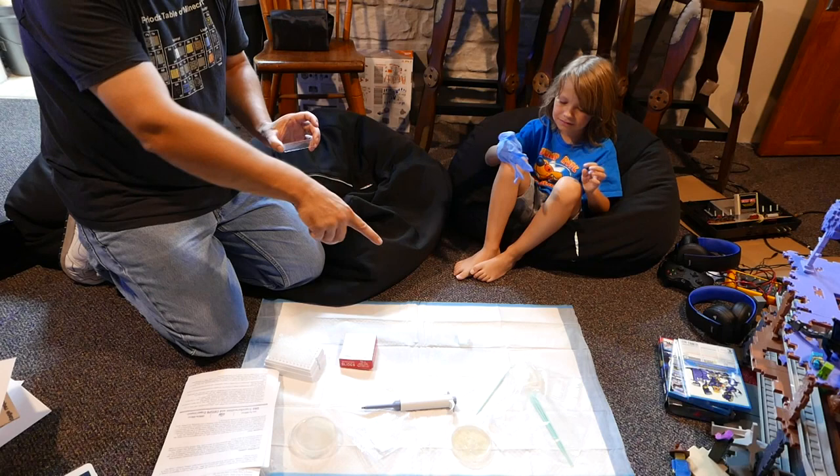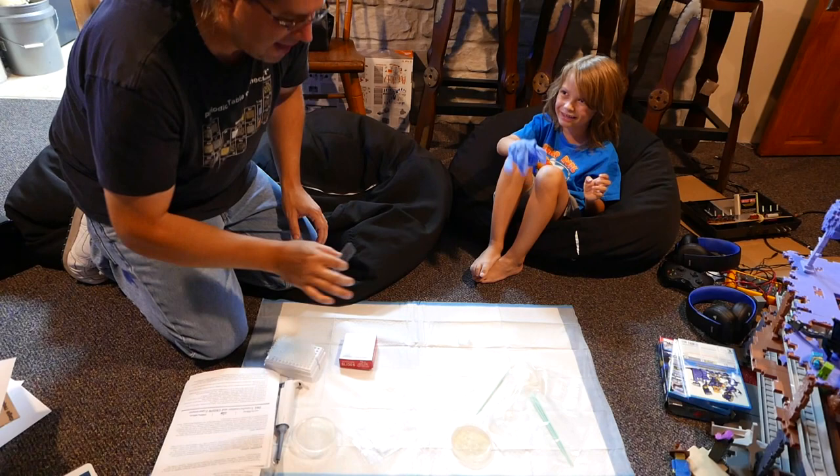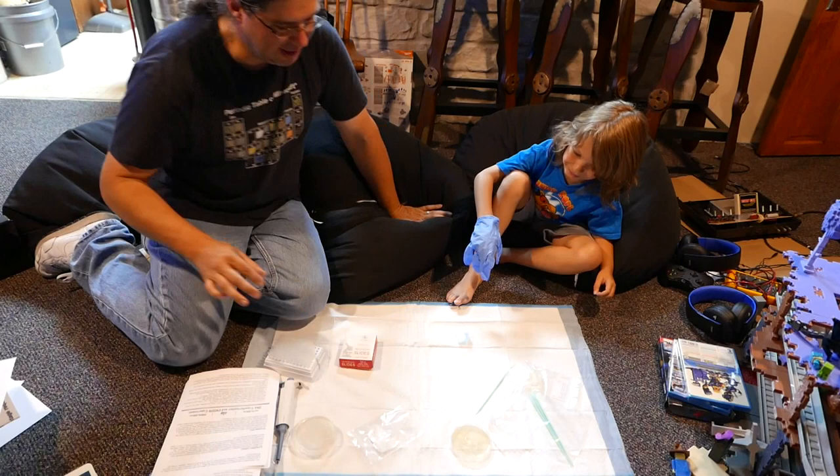So once you get the glove on, don't touch it. You said don't touch the glove after you do that. So slide this over here, put it here. Which way? This one. The one that looks like cheese. That doesn't look like cheese. I know.